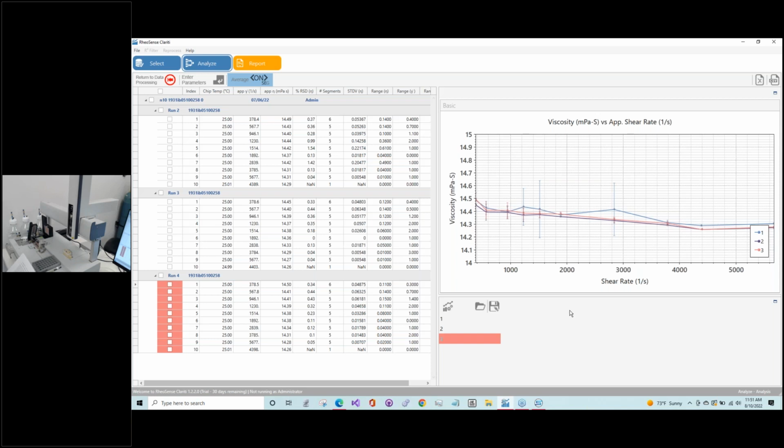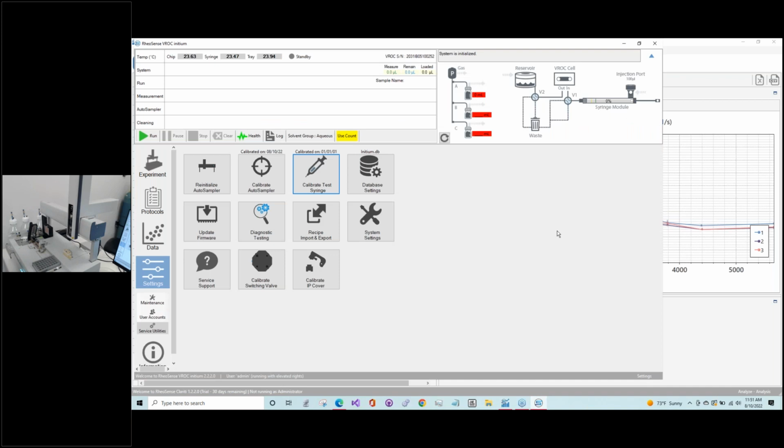And so the final thing is, if you do have some concerns, let's go back to the regular software. If you do have some concerns that you're getting some buildup, perhaps not a full clog, but some buildup of some troublesome samples, then we do suggest doing some extra cleaning of the system. A common one for the protein antibody type customers is the enzymatic cleaning. That's done by putting the enzymatic cleaner in a vial, loading it as a sample, and selecting a testing protocol.